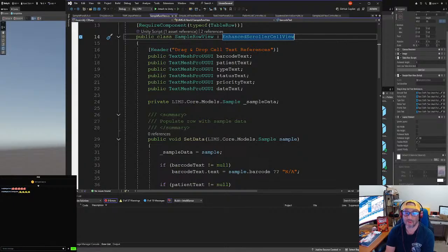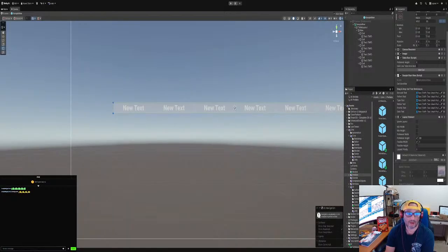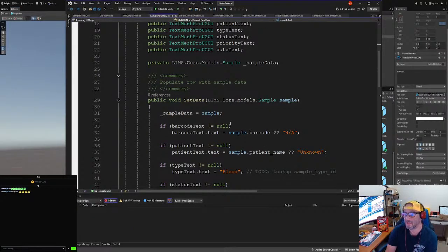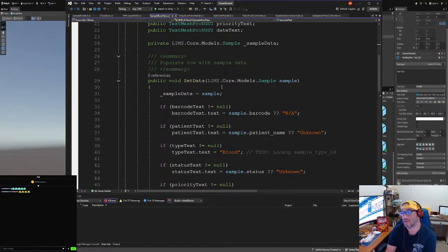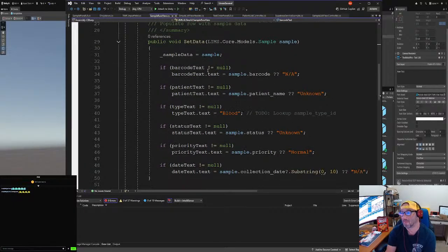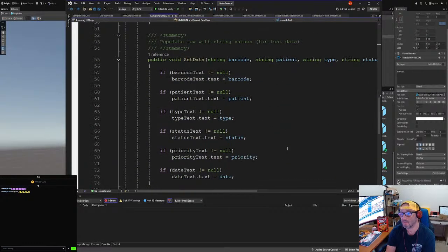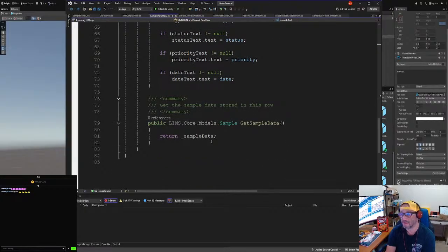The problem with that is we also have to adjust that in the screen. So we'll have to adjust that here, make sure the alignments are correct and all that good stuff. But basically, we set the data here. We tell it what data we want to use, and then in our script we call this up and assign it as you see here. If there's nothing, NA, basic stuff. Barcode, select the data, populate each, and then get sample data. That's pretty much it.